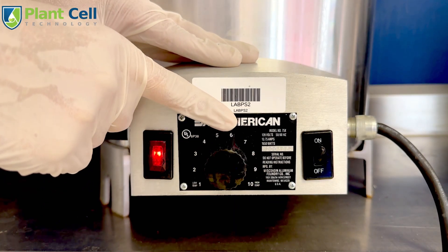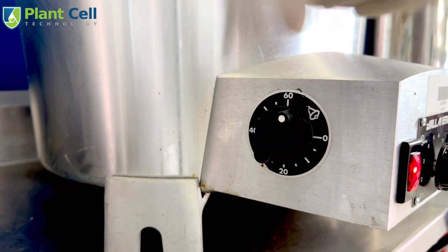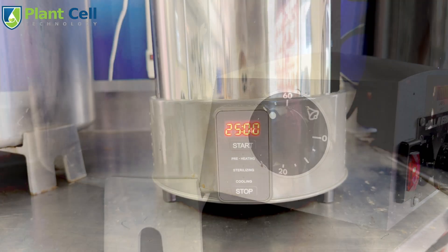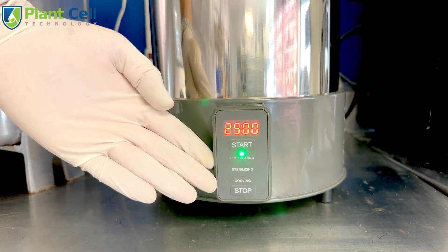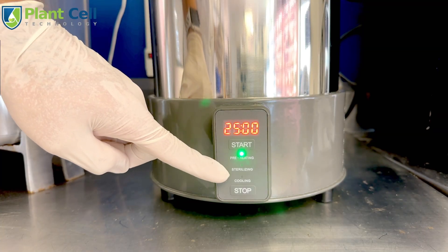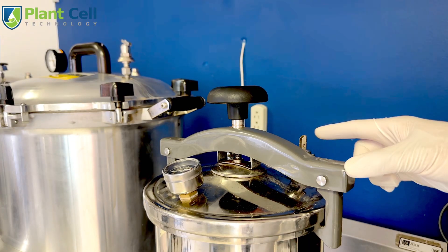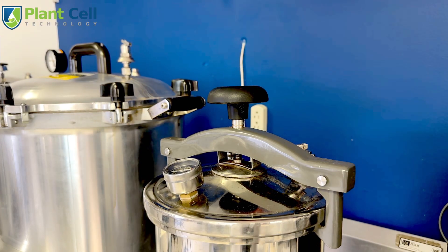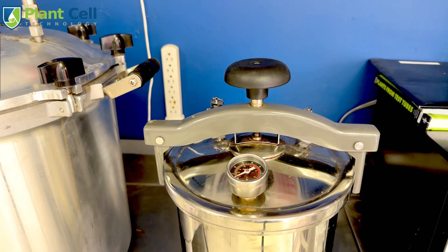To turn on the All-American, turn on the switch. It has a knob that controls the power of the pressure cooker and it also has a timer — however the timer is mechanical and not connected to anything, so it's very old style. For the Athena it has a very simple operation: just press a button and it starts to work. After 15 minutes you start seeing steam coming out of the Athena sterilizer.